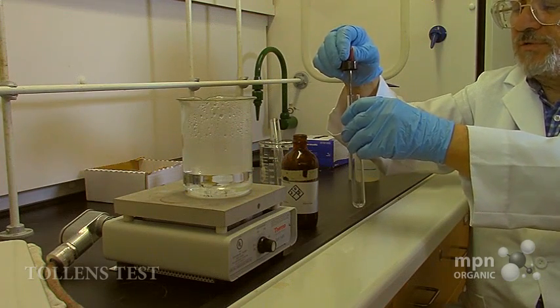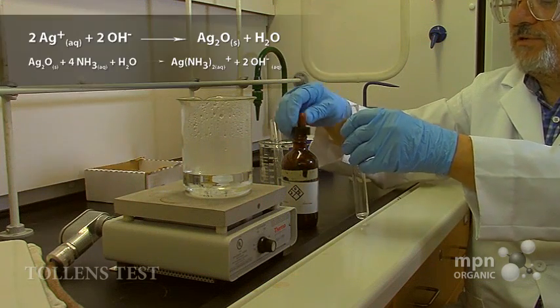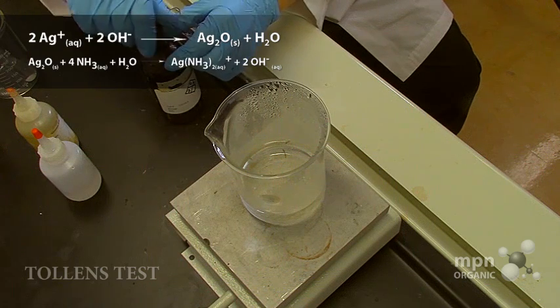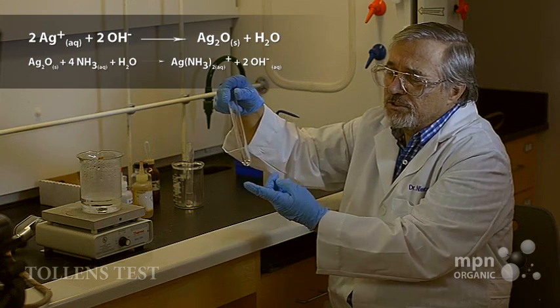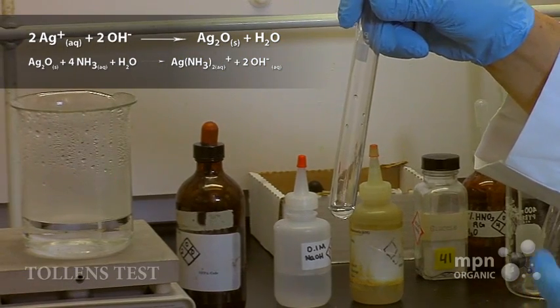We're going to put in some silver nitrate. Here, there's some silver nitrate. Silver nitrate is a colorless solution. You can see that there.